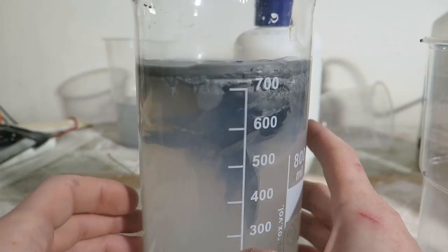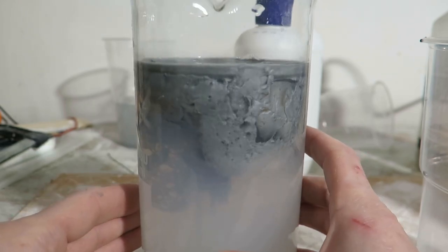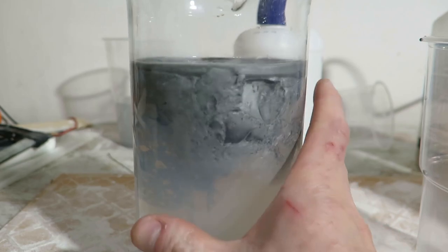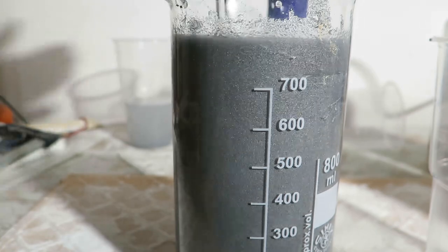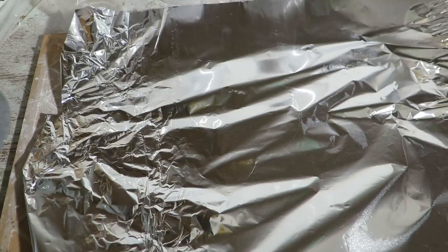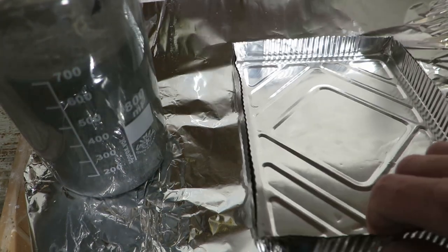So I poured it in in this stage and I must admit, this effect is pretty cool. I think I should call this Lung Simulator 2 million. Well anyway, then I added some more aluminium powder and mixed a lot. This at least shows you how important it is to mix this thing very well because it is gel and well, gels do not mix very well.